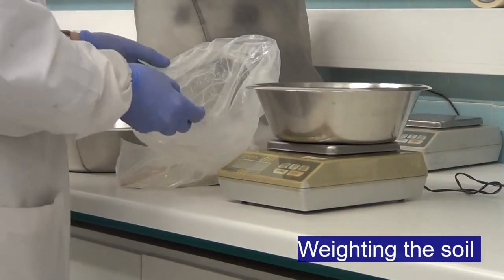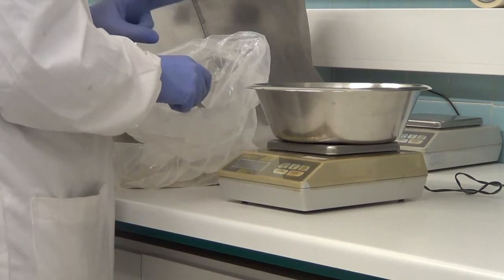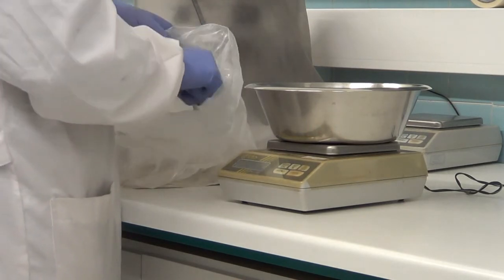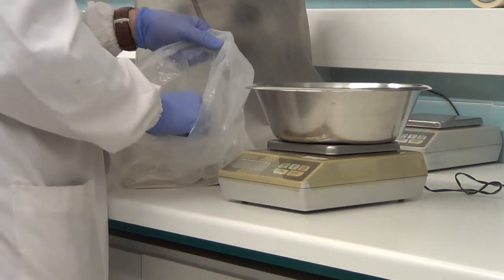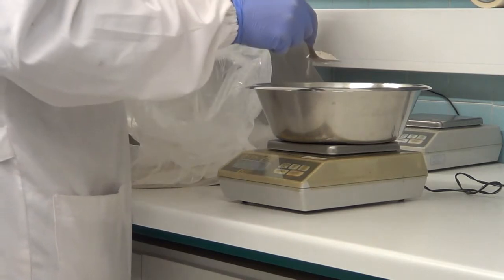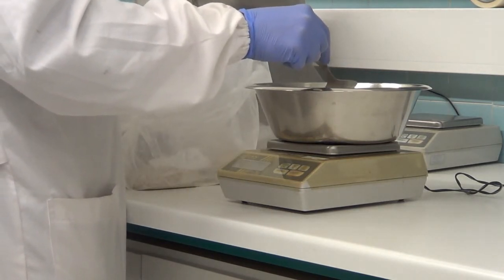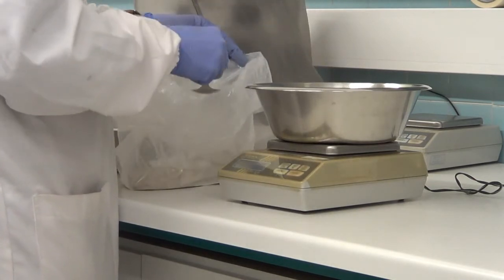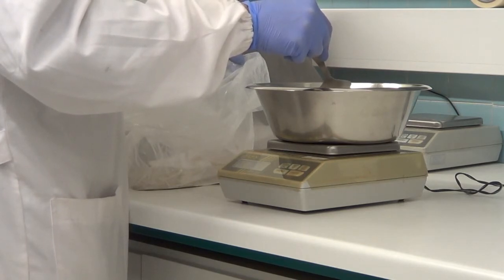So now we will weigh two batches of soil, 250 grams each, because it will be the soil for each section of the replicate. We have our OECD soil, and we should weigh 250 grams of soil in a tray, then mix it with the solution or the water that we want.